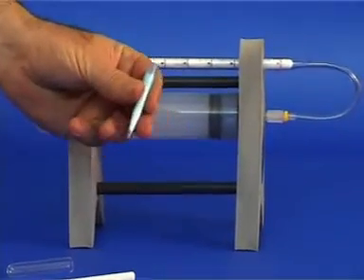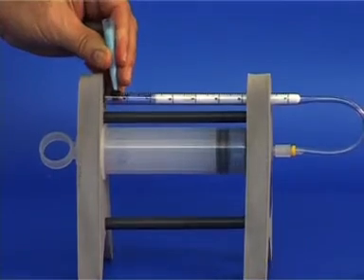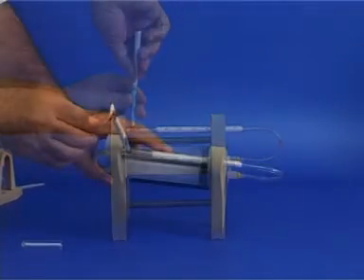Take the small cotton filter and insert its sharp end into the opening on the long filter tube. Now insert a cigarette into the small filter and light it.